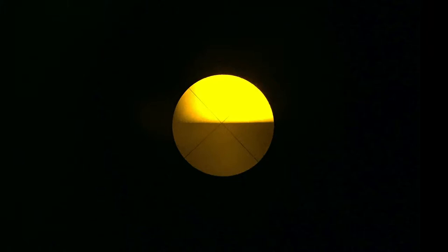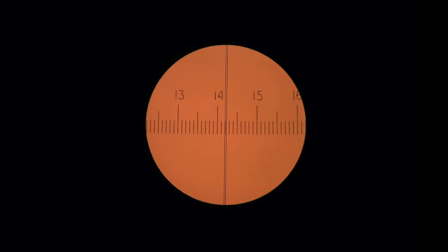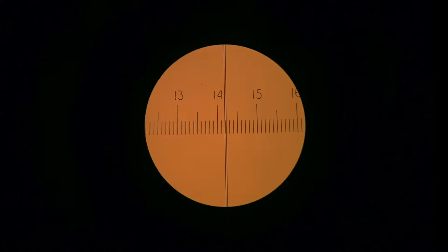Here is an example of what a fringe looks like after I've moved the coarse dial into the line of the 589 wavelength. Everything on the black side is refracting away. This is the measurement of the other eyepiece, so it's like 14.2, and then moved over with the fine dial, which is the upper dial.